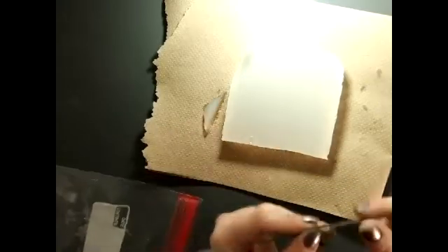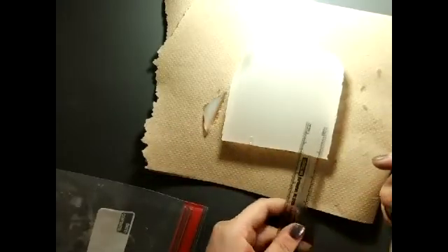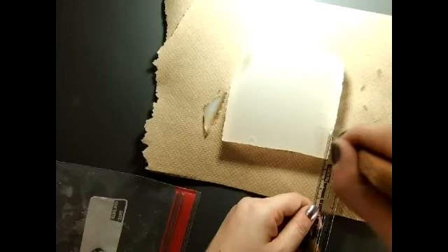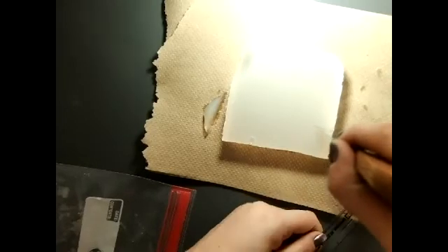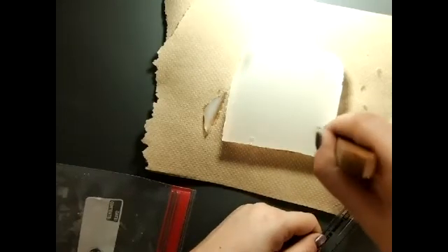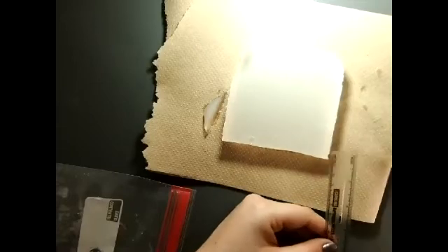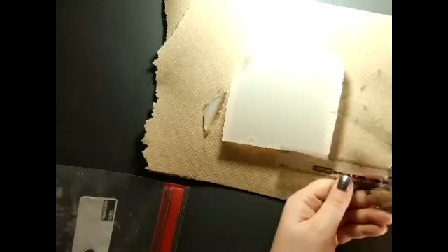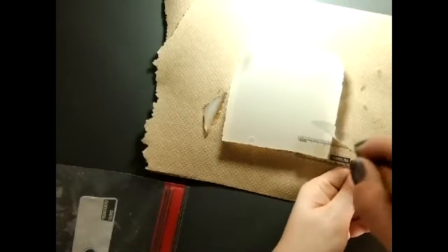So just lay this here, and cut in at the 0 mark. And we'll go 3 centimeters that way also.